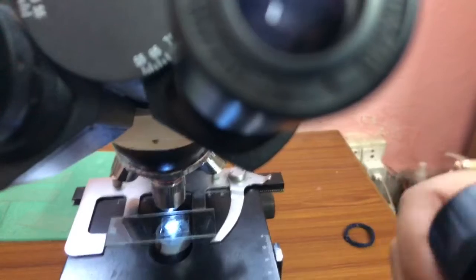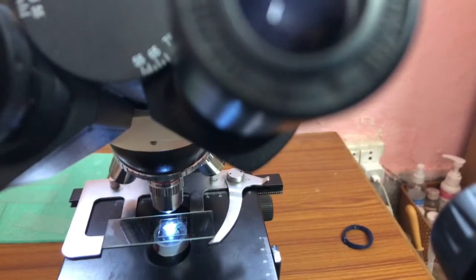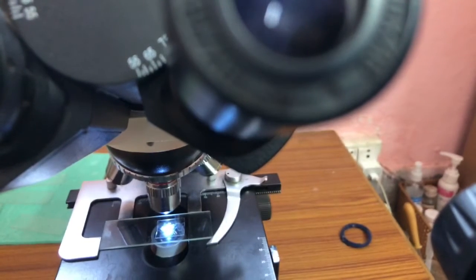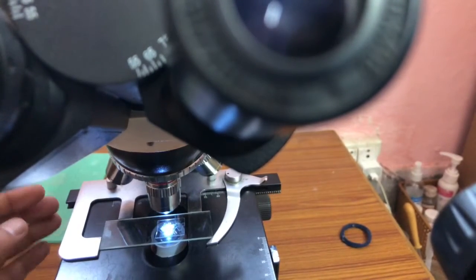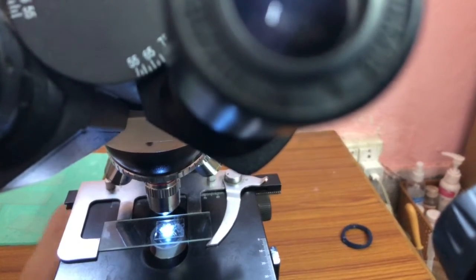So I just took that on a micro slide, and now that I'm watching it, I find a lot of activity there. On the slide, we have this little dead larva, and on that larva, we have a lot of foraging insects, not insects, a lot of activity on that particular larva. A lot of ciliates and other animals are busy consuming it. It's a kind of a frenzy.